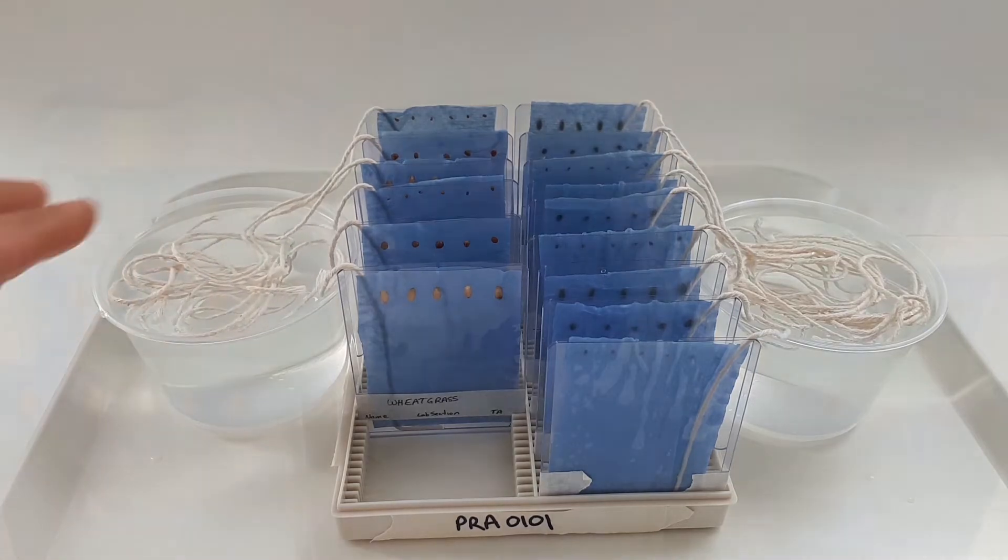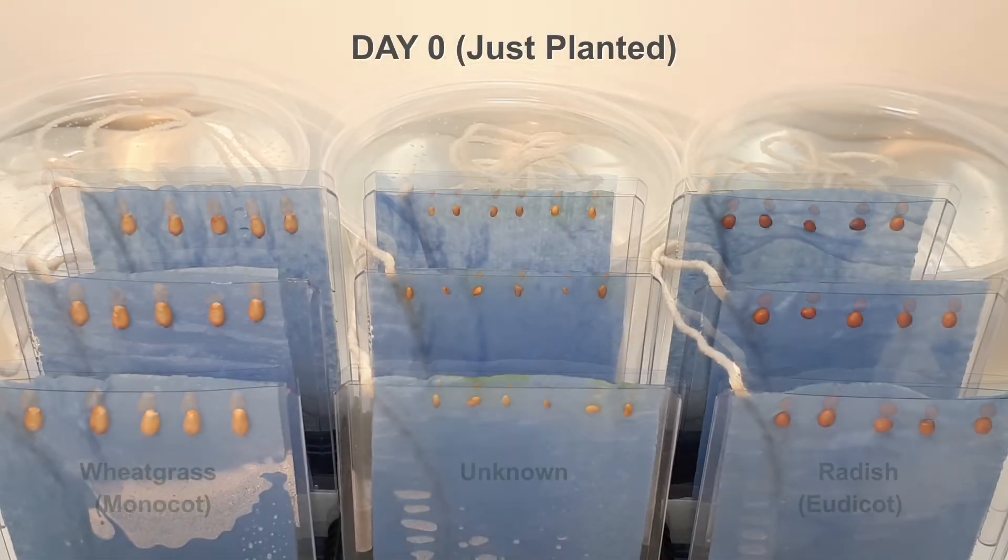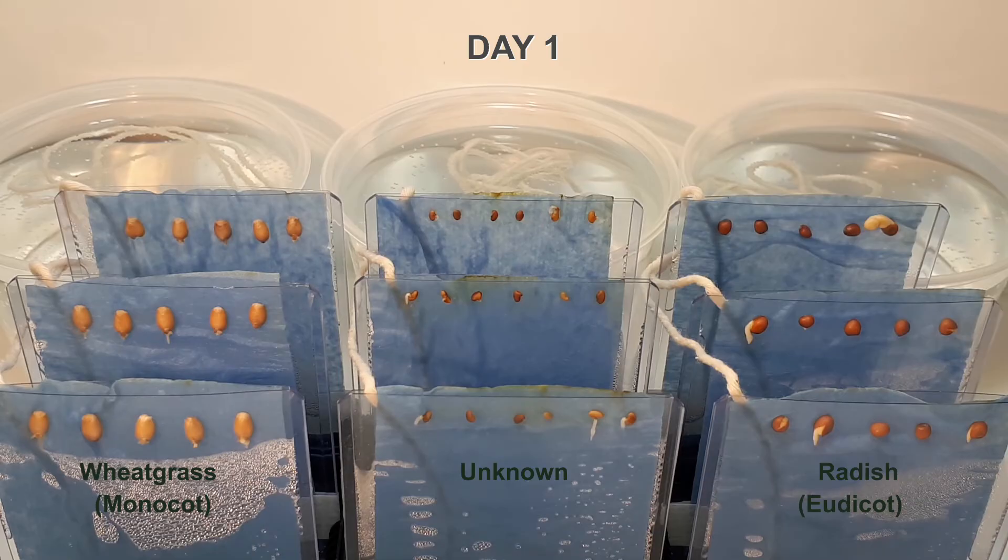The plant pockets will then be placed under high light conditions until your next lab when you'll be able to examine the growing seedlings.